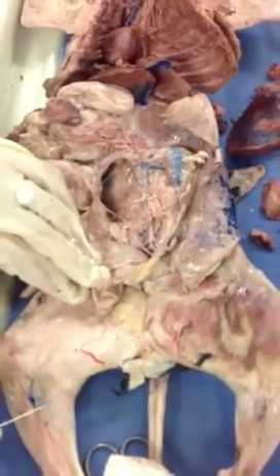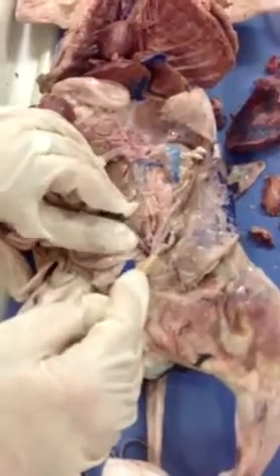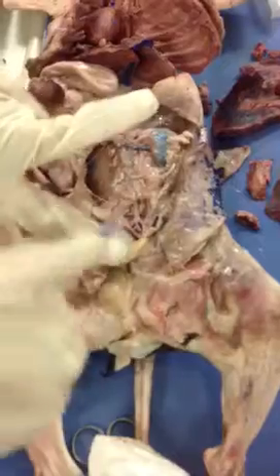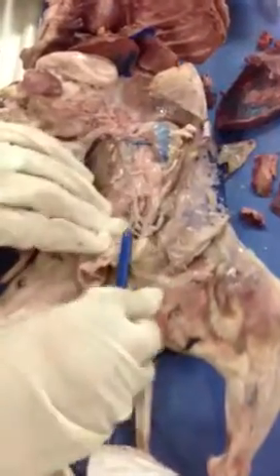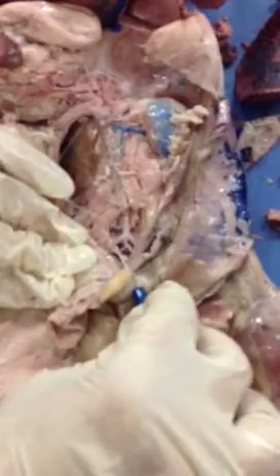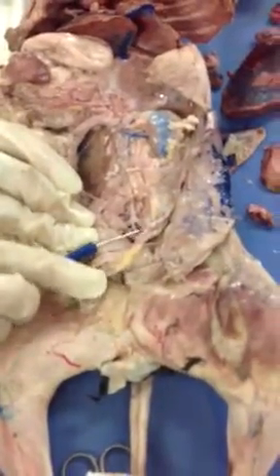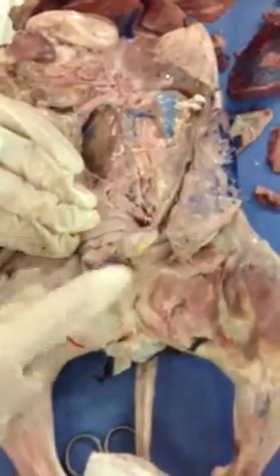Iliacs, right? So we notice that this abdominal aorta comes to a point that it bifurcates, right? You notice how it forms like this V shape? So when it does this bifurcation, we call it the external iliacs. So this is going to be my right external iliac, you see it? And this is going to be my left external iliac. Go on, please.